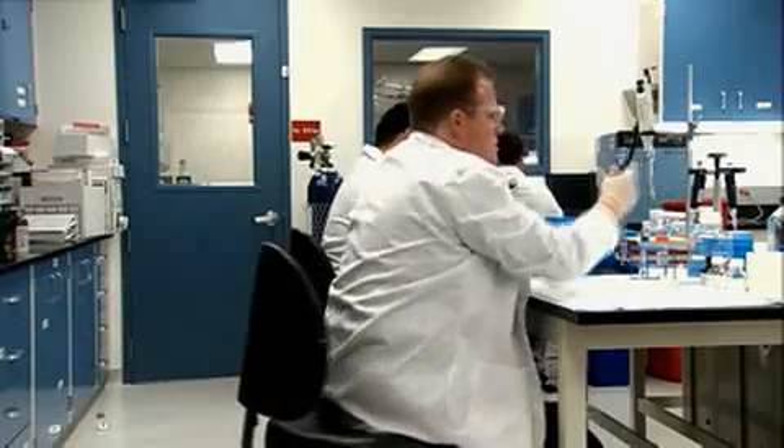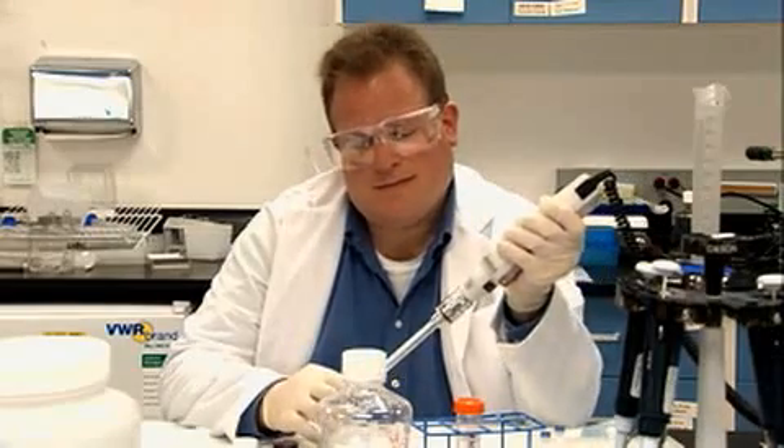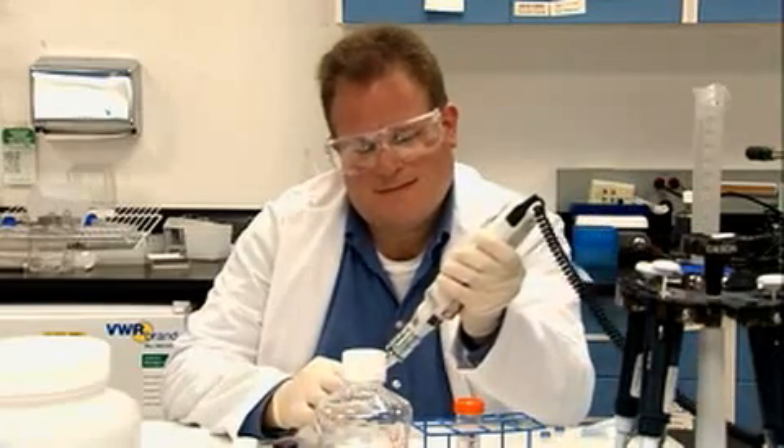Approaches the bench. You can see he's really leaning on that thumb. Clockjack. And he's off. He's only a rookie, but just look at the confidence as he starts to homogenize.